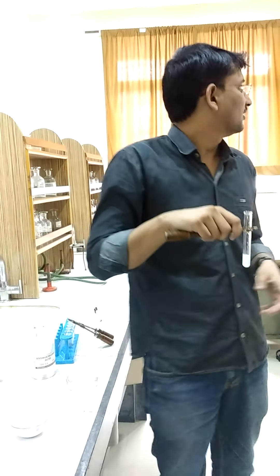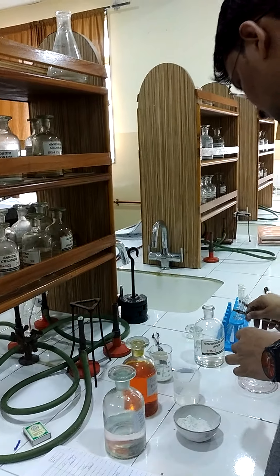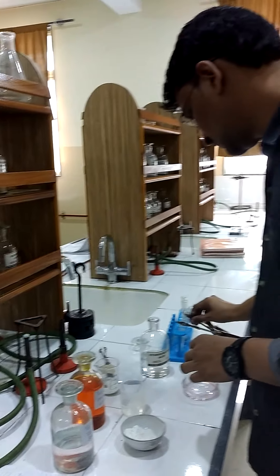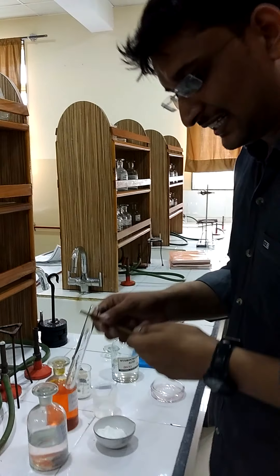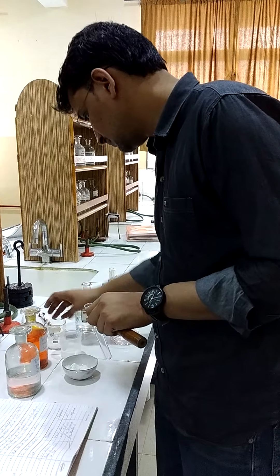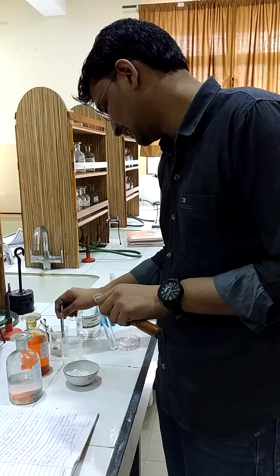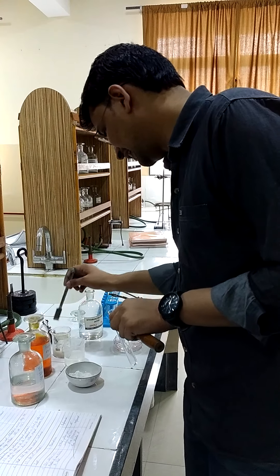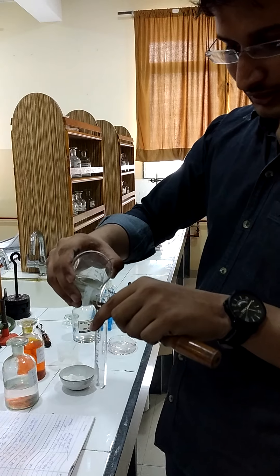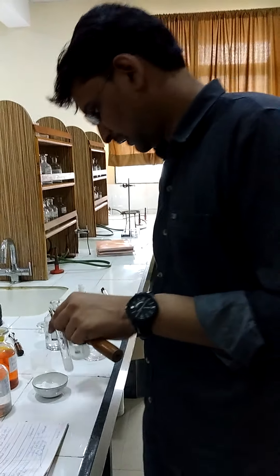Now we will do the confirmatory test for that. For the confirmatory test, we are going to take the OS. It is sparingly soluble, that is why it is getting deposited at the bottom, so we will have to put it into solution.